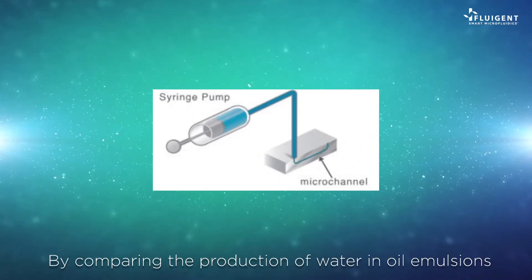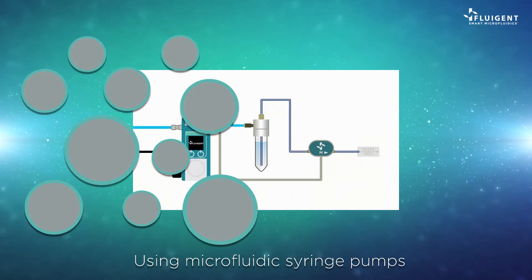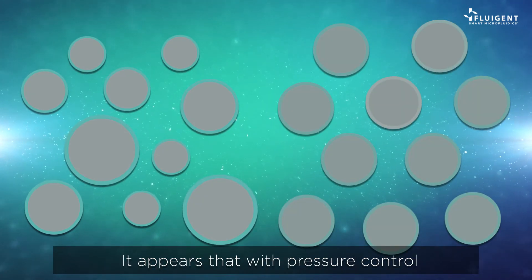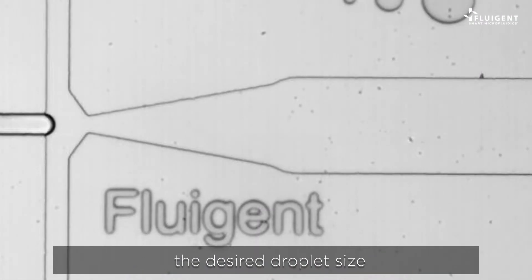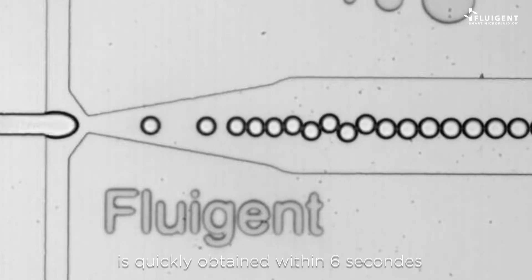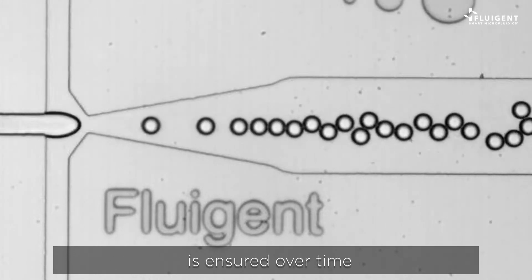By comparing the production of water-in-oil emulsions using microfluidic syringe pumps and pressure-based flow controllers, it appears that with pressure control, the desired droplet size is quickly obtained within 6 seconds, and monodispersed droplet generation is ensured over time.